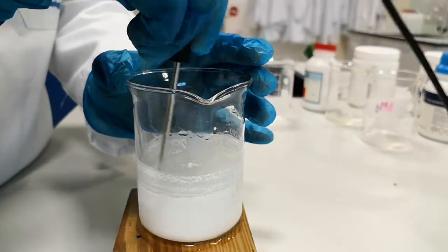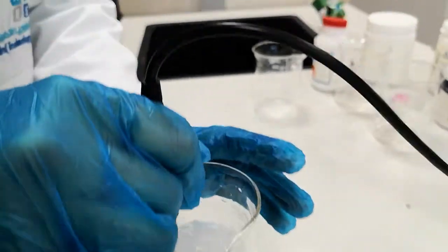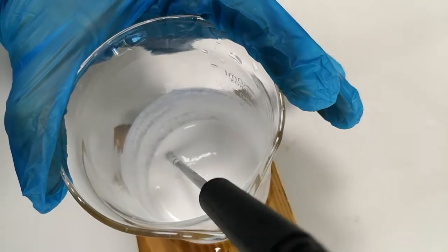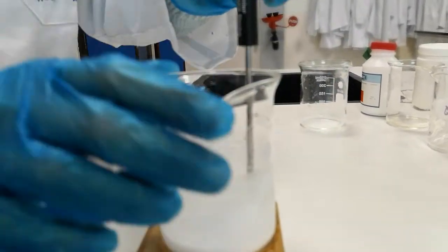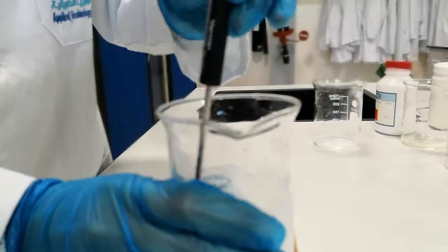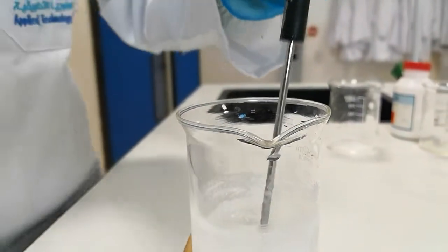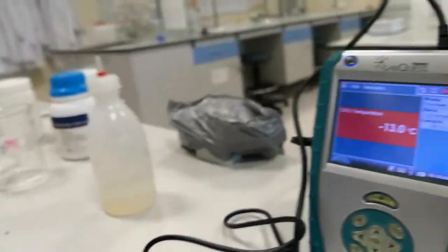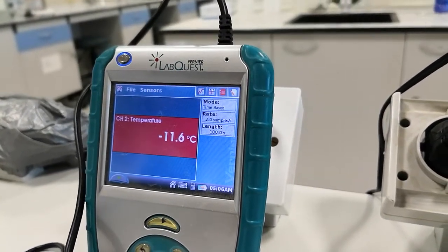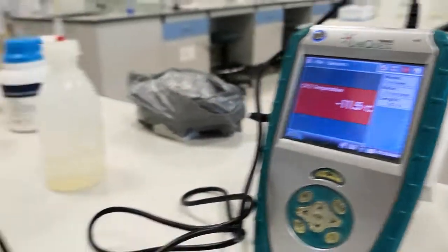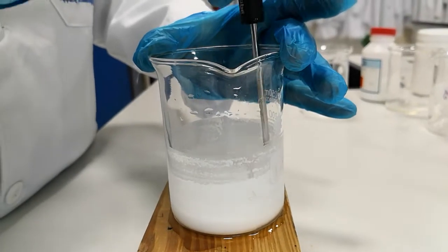So it is like a white liquid now, and the beaker is very cold. The temperature keeps on dropping.